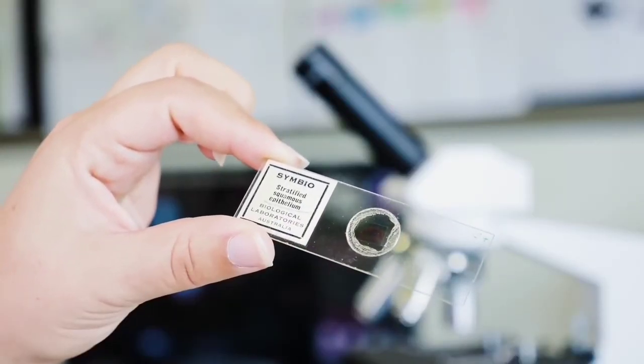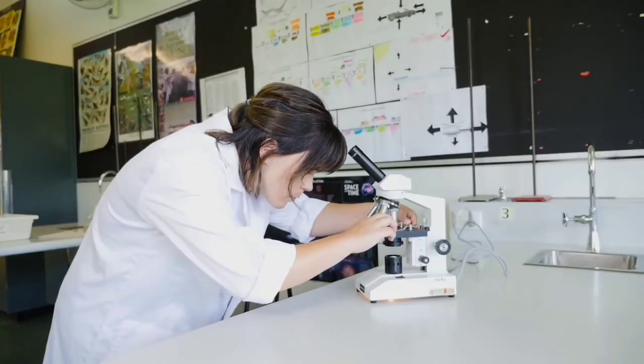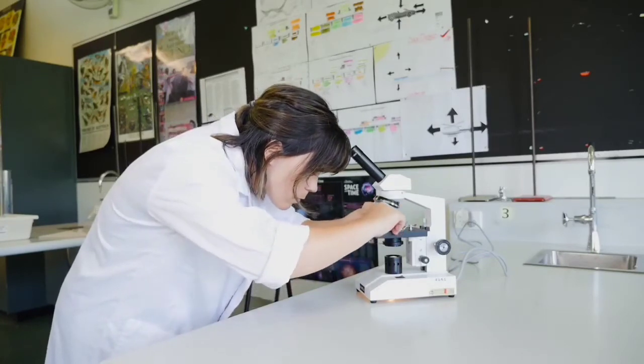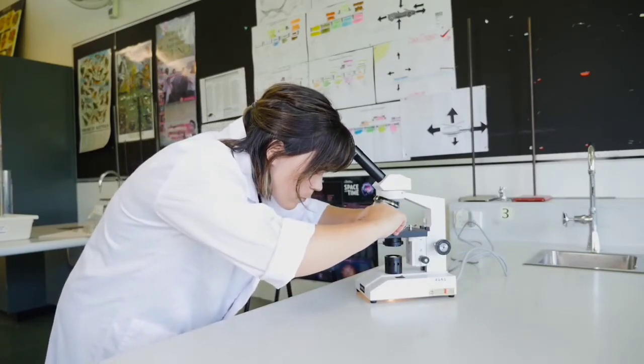Here's a slide. Take a close look at it and find the specimen. Put the slide on the stage so the specimen is right in the centre of the hole in the stage where the light comes through. Then clamp the slide in place.